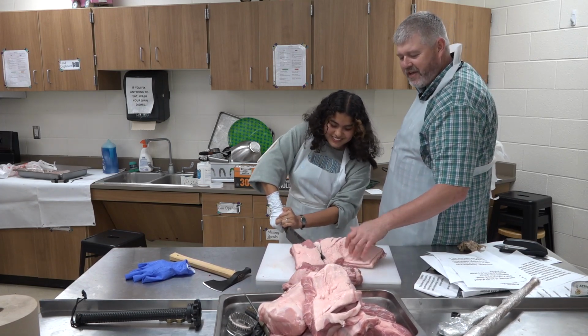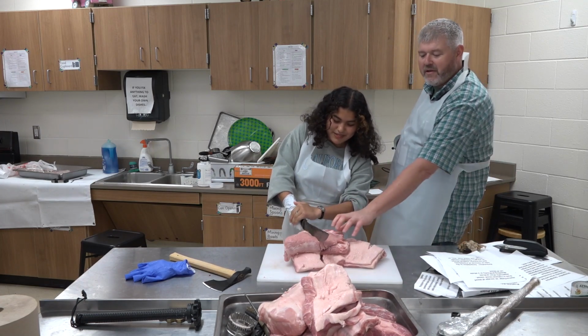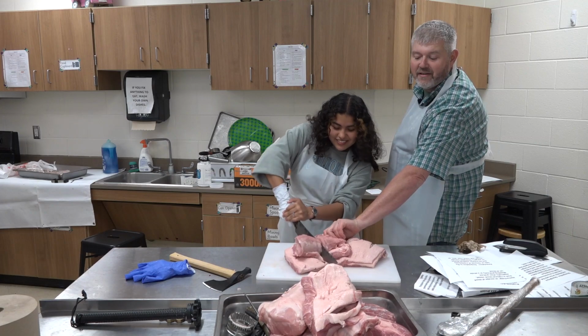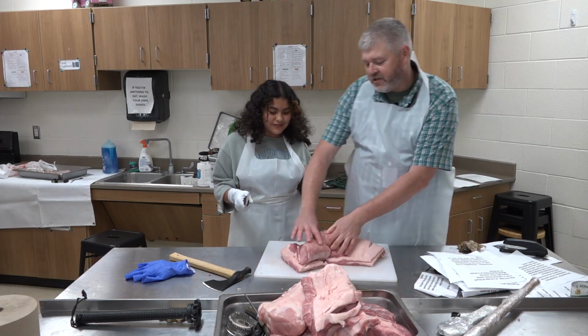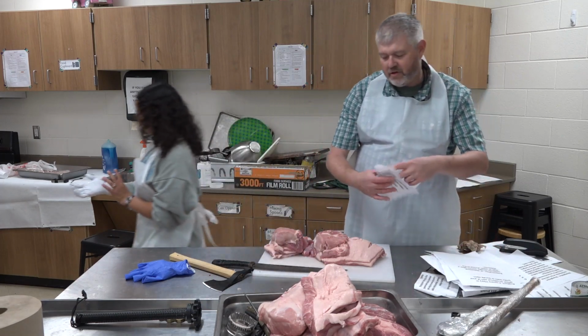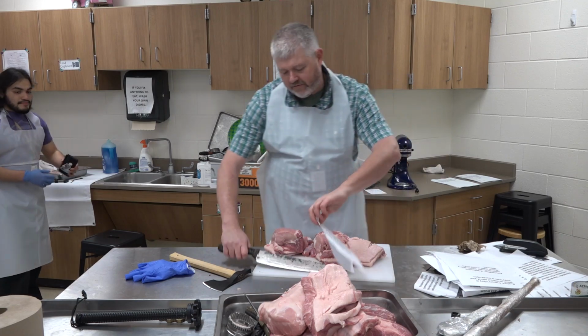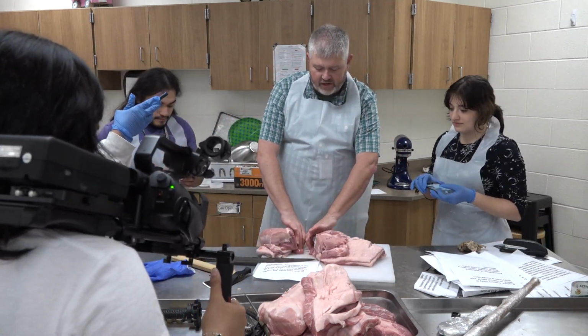Okay, you got that one piece, lift it up. Keep going. My bad. Oh, no, you're good. Okay, that's essentially what an amputation is, guys. It's a full removal of tissue from itself. Like you have fully cleaned the tissue off.